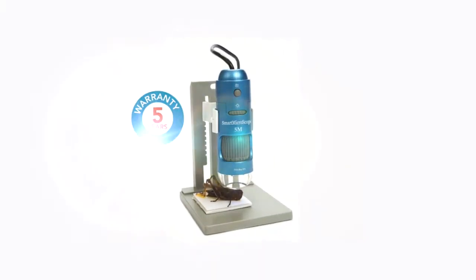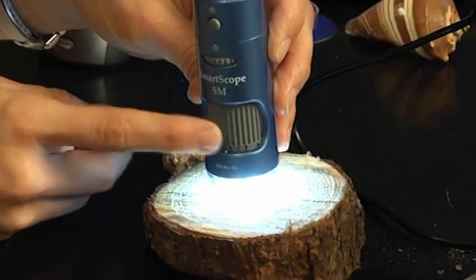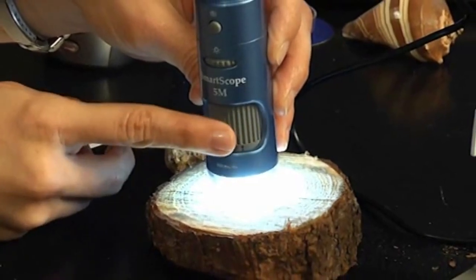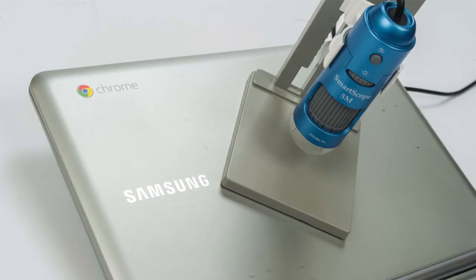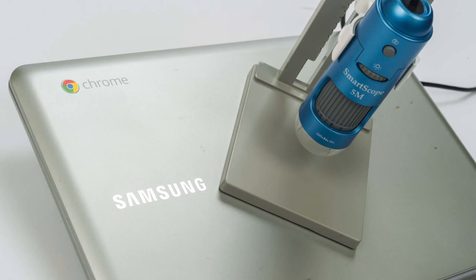Introducing the Smart Microscope 5M. The Smart Microscope 5M by Smart School Systems is a visual learning tool that gets students excited and keeps them engaged. It includes the Smart Microscope Online Viewer web app, so no software install is needed, making it perfect for Chromebooks — the most popular computing device in U.S. classrooms.